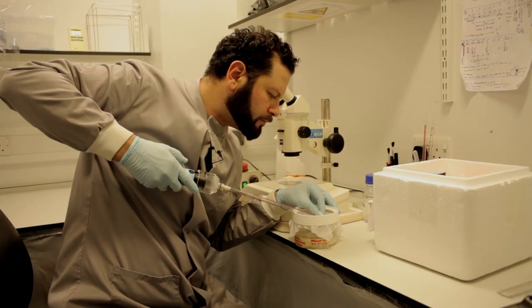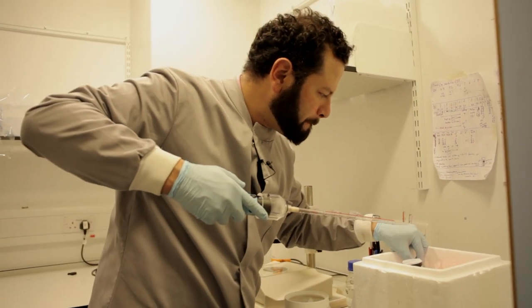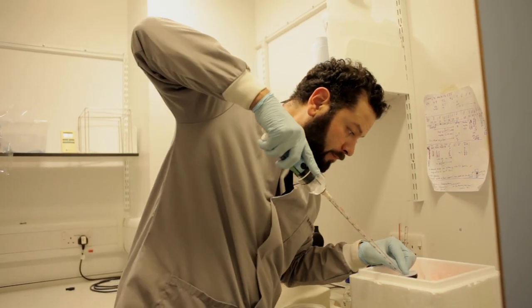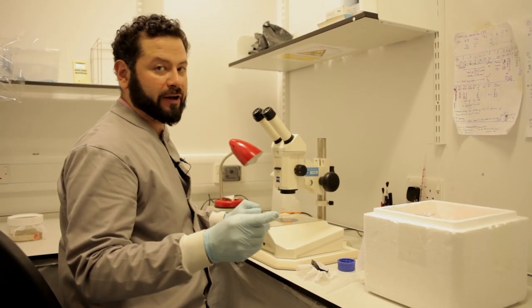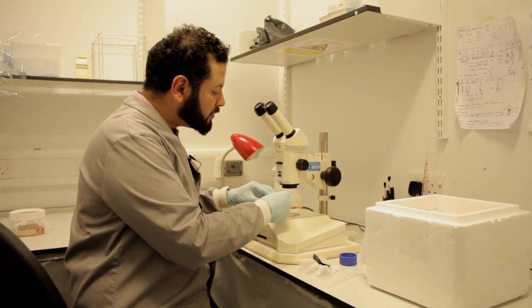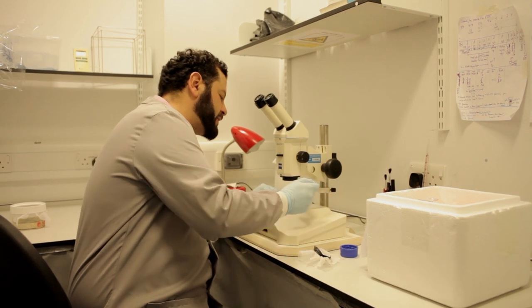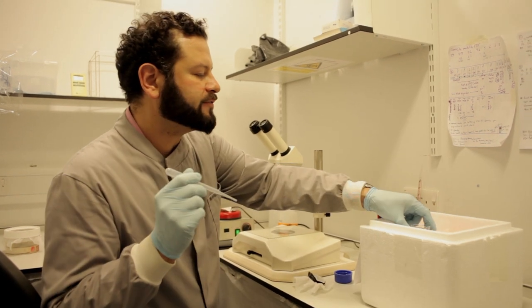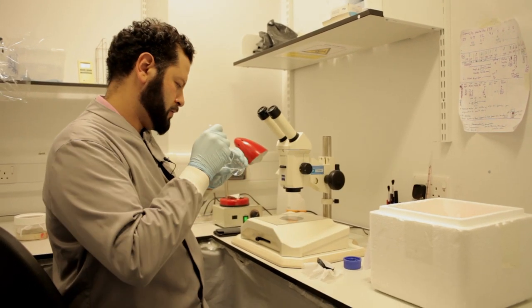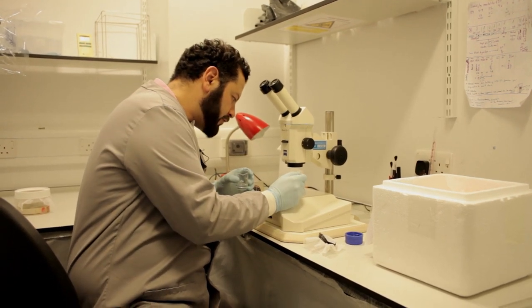In this video, I will show you how to dissect a sand fly gut. First, I place the flies in cold dissection solution for a few minutes to anesthetize them and keep everything on ice until needed. Then, I take a microscope slide, place it on the microscope with a drop of dissection solution, and then, using the plastic Pasteur pipette, I transfer the fly onto the slide.